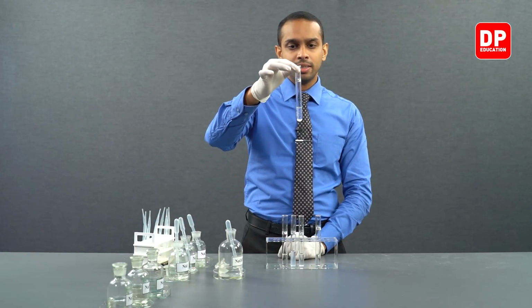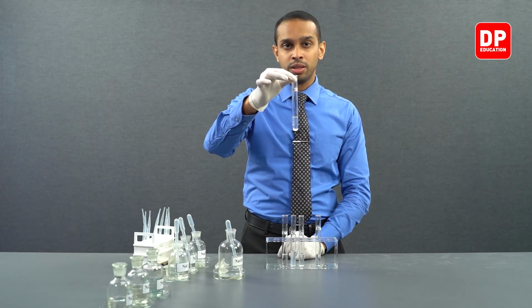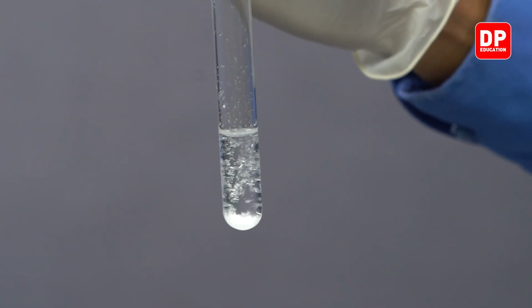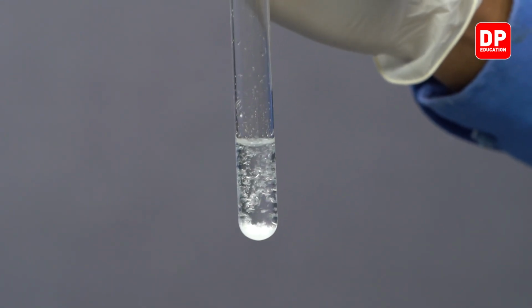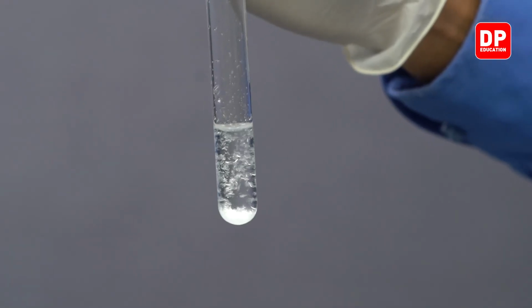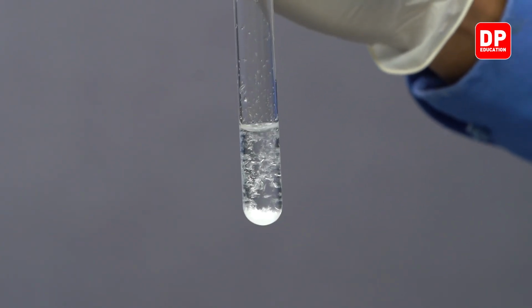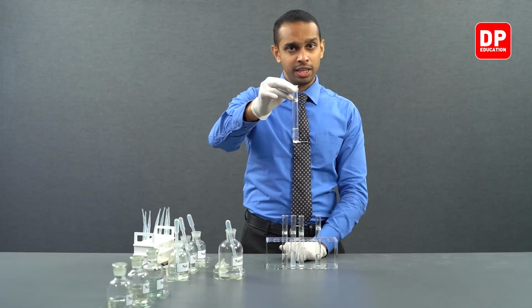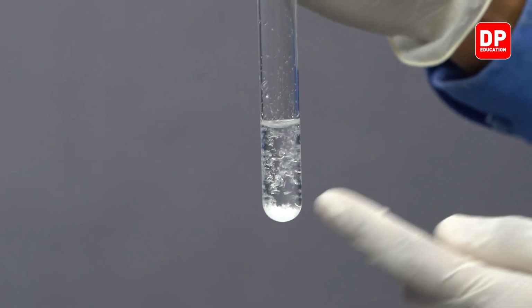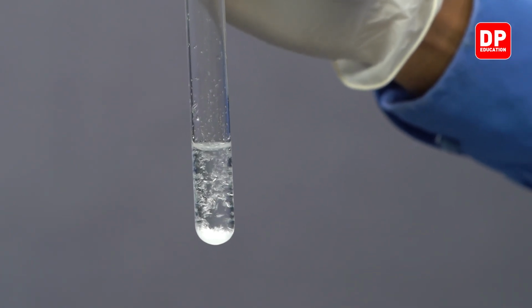Then we have here our strontium 2 plus aqueous solution reacted with hydroxide ions. We have strontium 2 plus aqueous ions reacted with sodium hydroxide. And as you can see, strontium hydroxide that is formed did give us a precipitate. This precipitate is also sparingly soluble, and you can see strontium hydroxide crystals very clearly formed here.